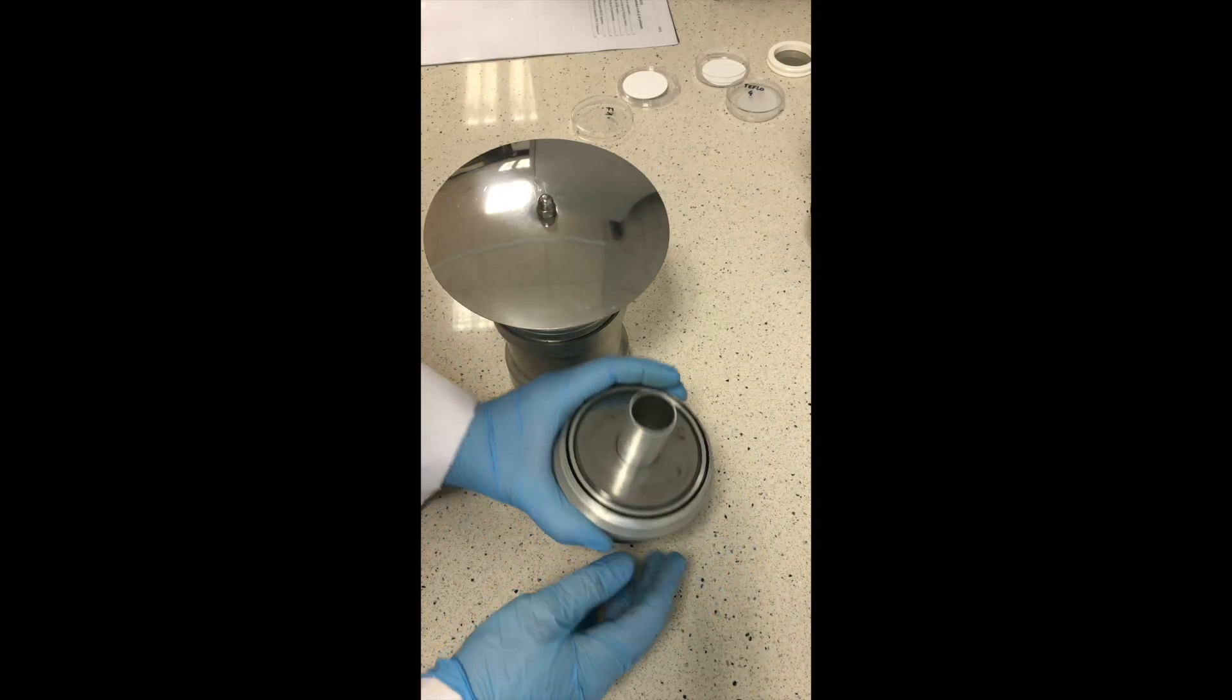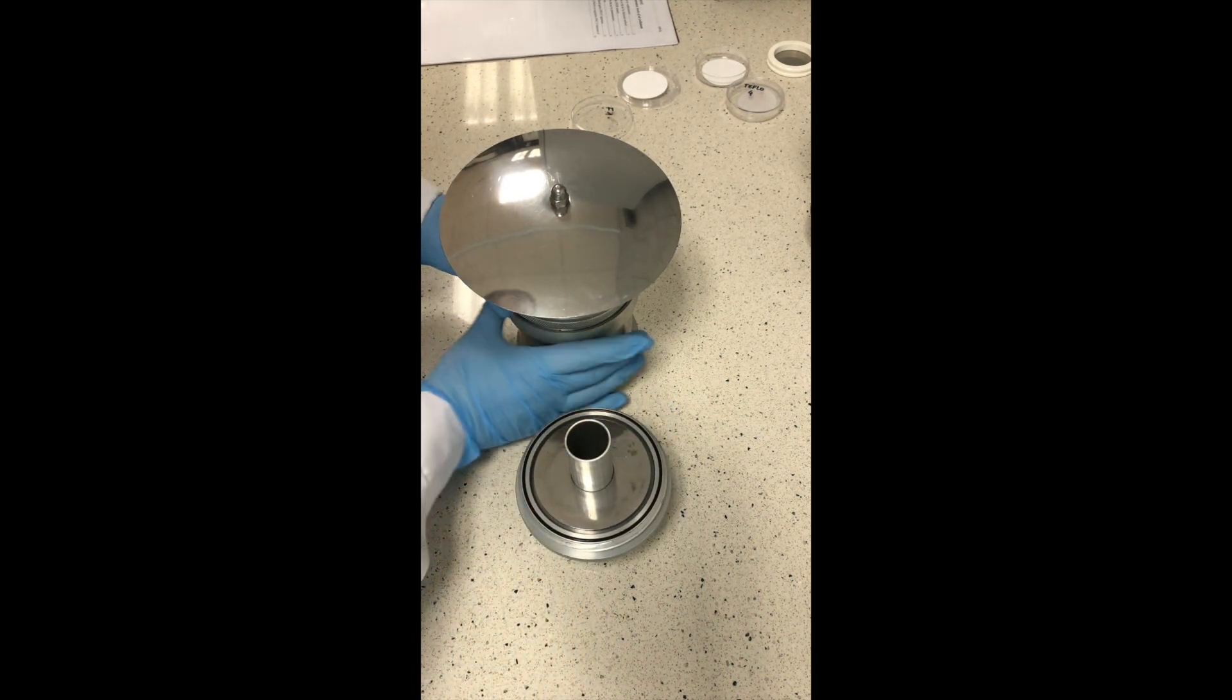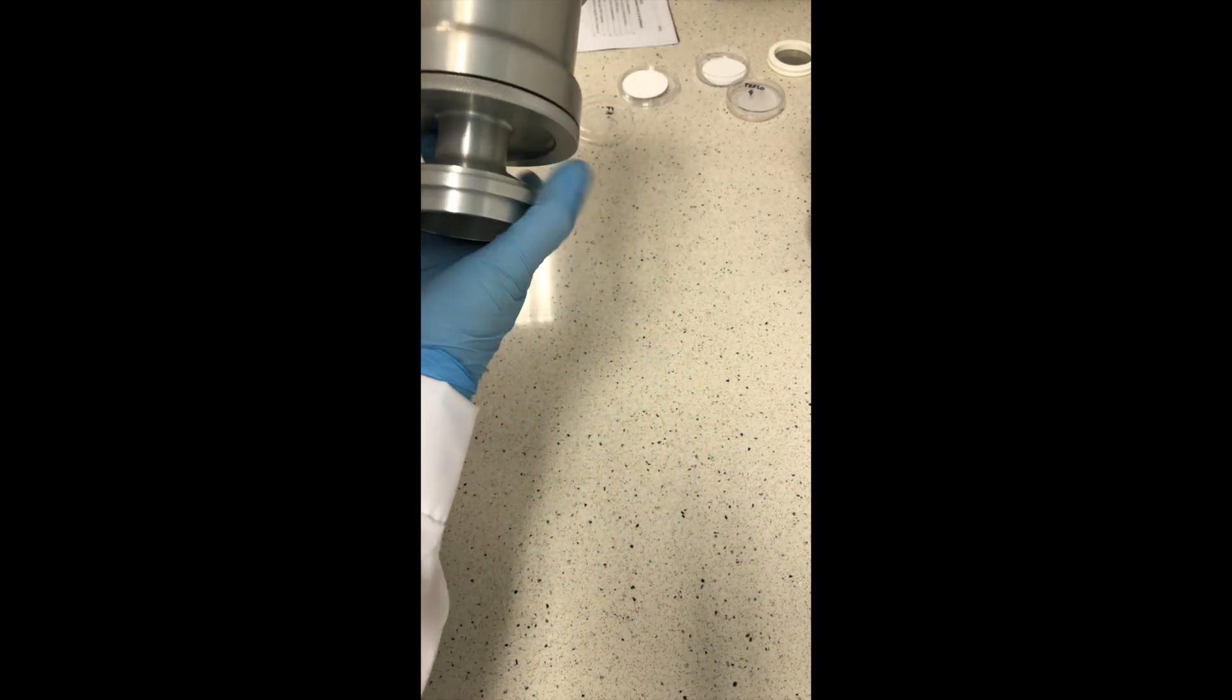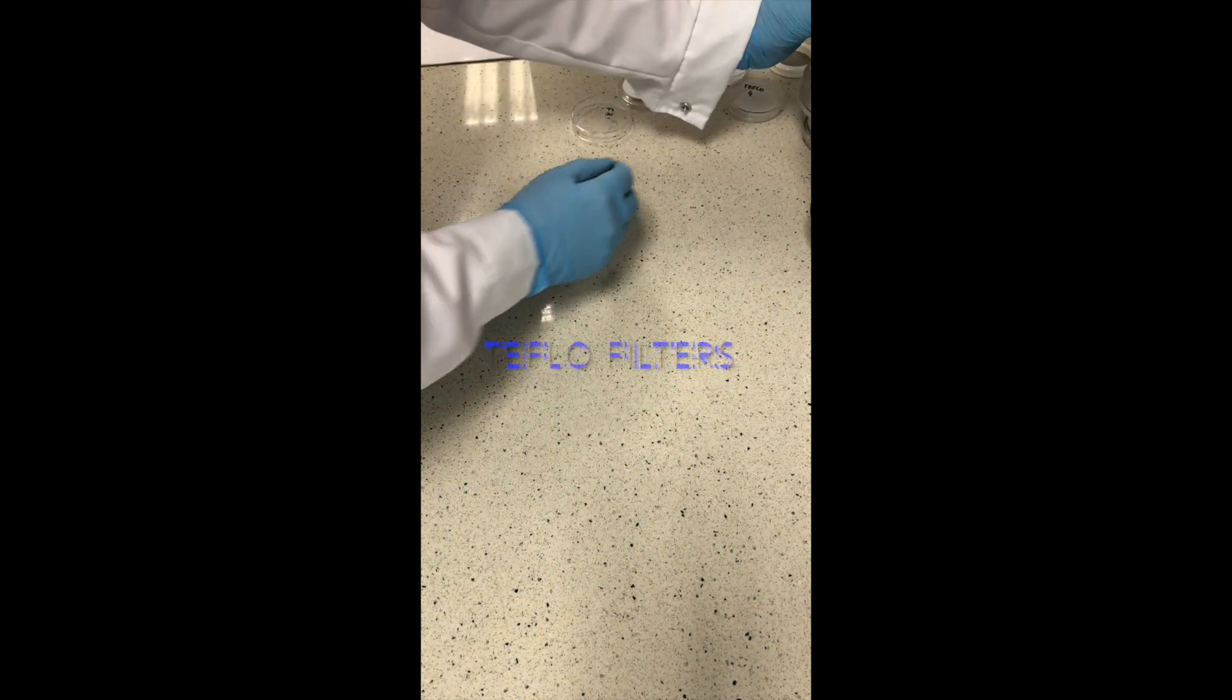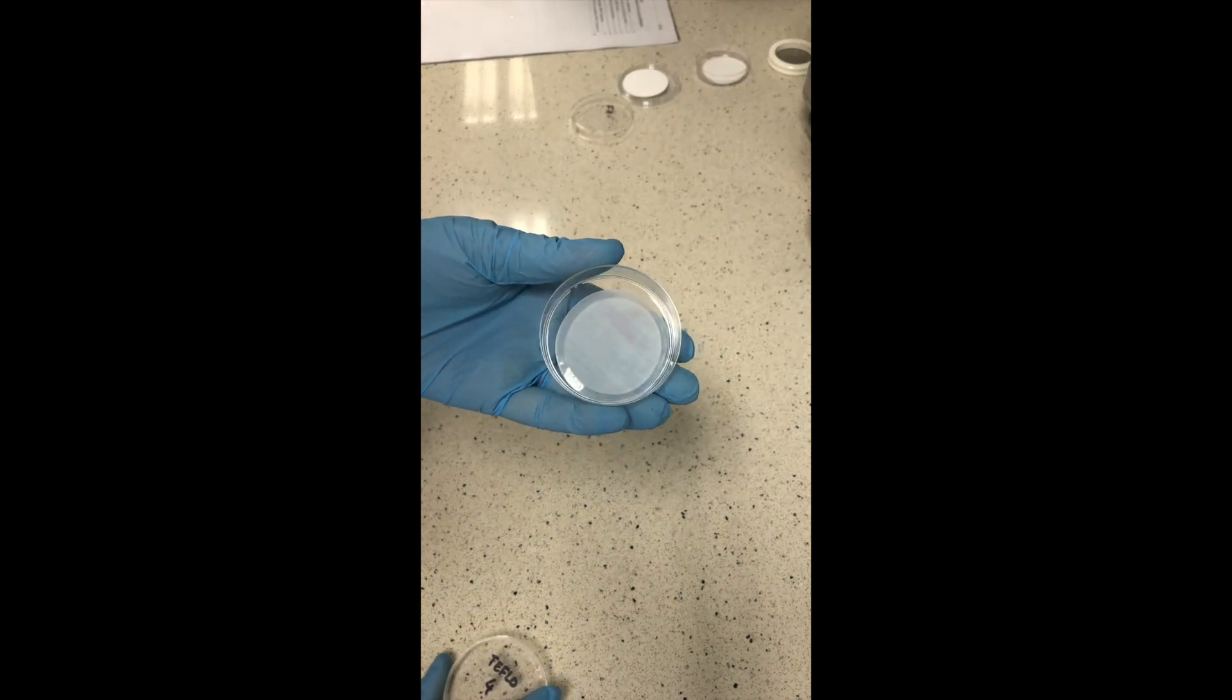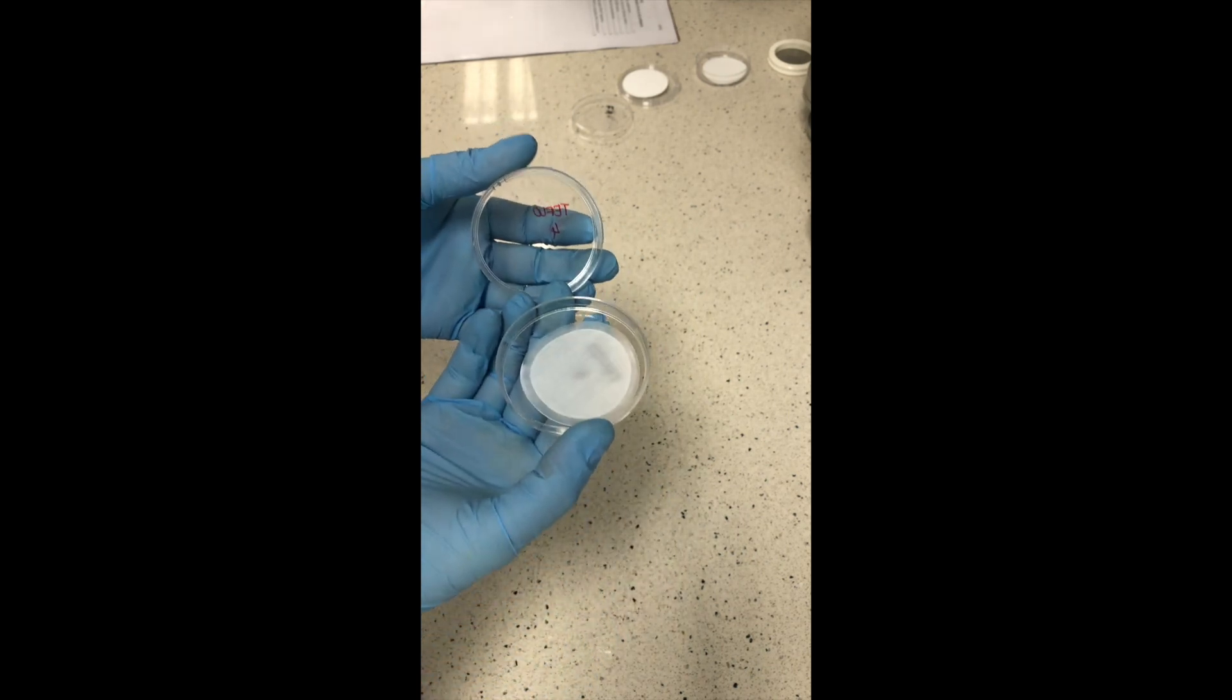To perform this exercise, you need also the filter. There are different types of filters. There are Teflon filters. And this is how it looks, the Teflon filter. This is very thin and very delicate.